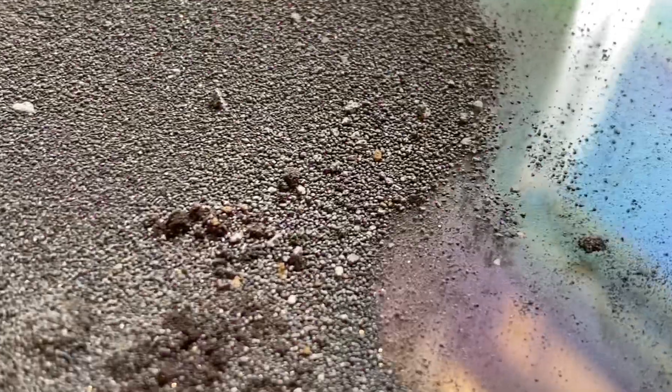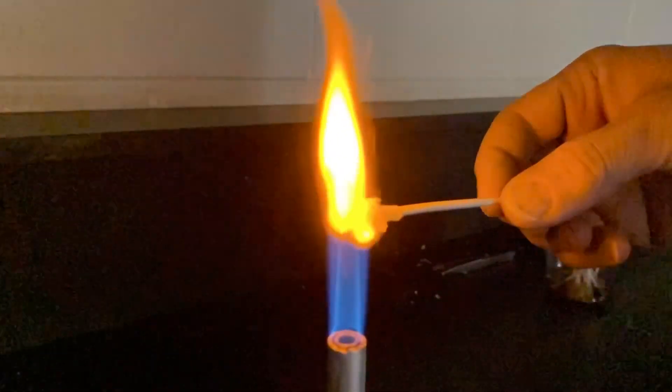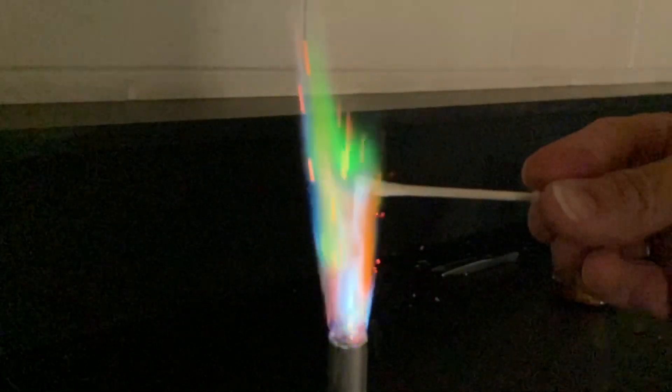So what do we have to do? We have to take careful observations of all 15 chemicals. We'll look at initial observations — color, texture — and then do a flame test to see what happens when those chemicals are burned. You're going to help by documenting all physical properties before the flame test: color, texture, size, reflective properties. Then you'll watch us burn each chemical to see if the flame color is unique and sets that chemical apart.